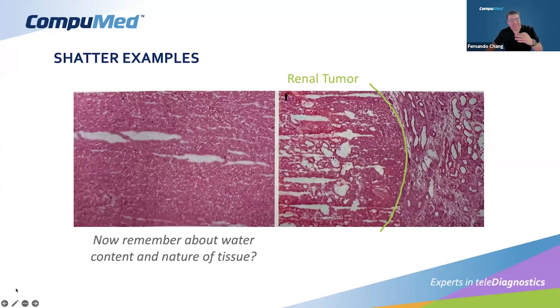But in these cases, the tissue is sick, and because of that characteristic, we can see shatter even in the same tissue. This gives us an idea of how even the same tissue can behave in different ways, and how intrinsic morphology, intrinsic characteristics of the tissue, like granulomatous tissue or microcalcifications, can affect the frozen section as well.